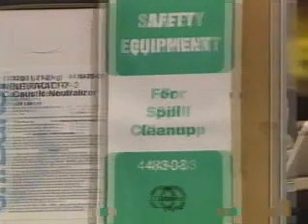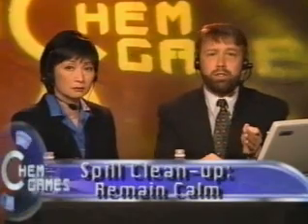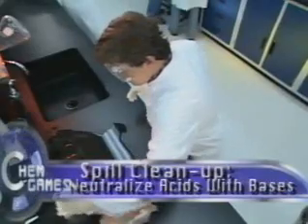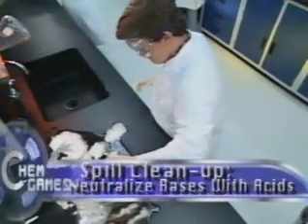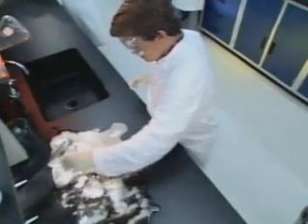Calm down, Mia. The key to dealing with any lab emergency is to remain calm and act deliberately. The proper method for cleaning a spill depends on what was spilled. If an acid is spilled, they must first neutralize it with a base and then clean it up. If it is a base, they need to use an acid. You can't start cleaning up the acid or the base until they have been fully neutralized. And don't use water to clean up a flammable chemical, because if it catches fire, the water will spread it out.